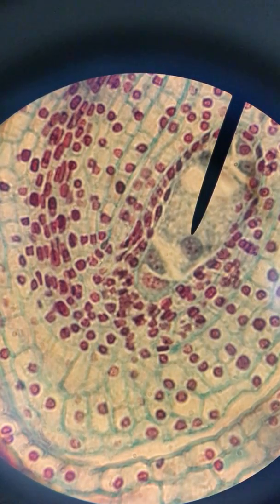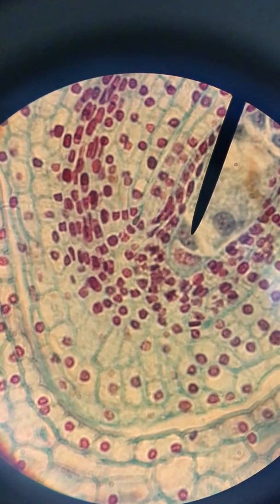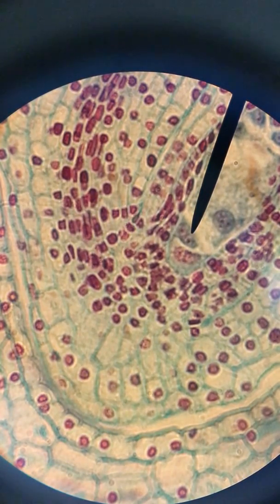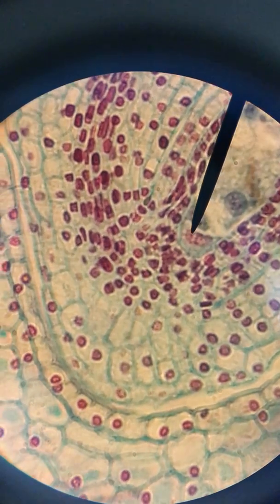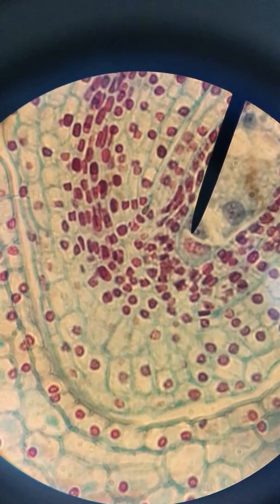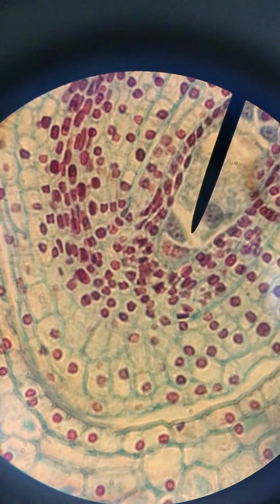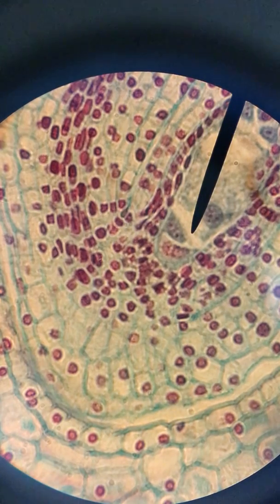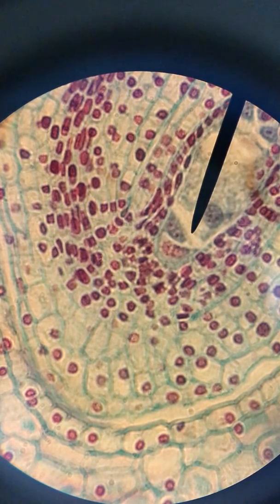The last three nuclei will be at the other end of the embryo sac. Here is one, here is another, and there would be a third. These are three antipodal cells, so they are at the opposite end from the egg and the synergids.